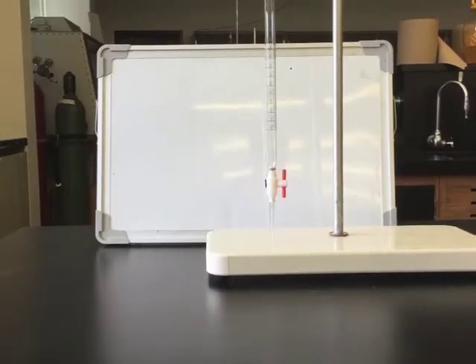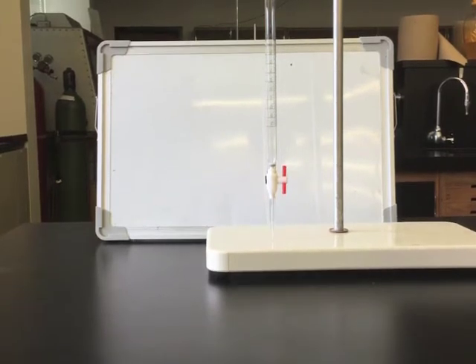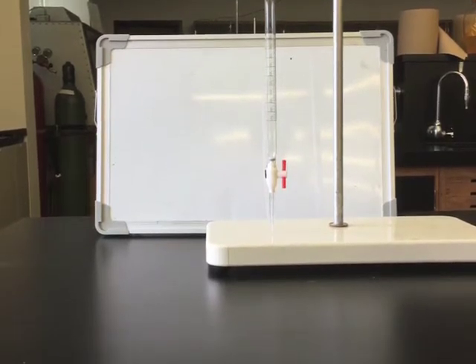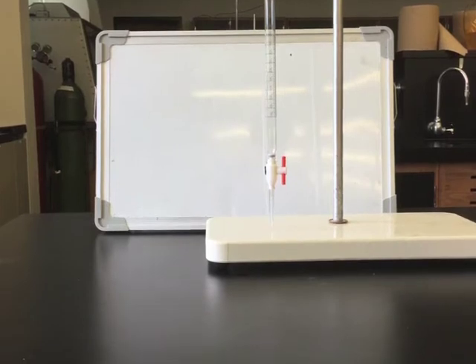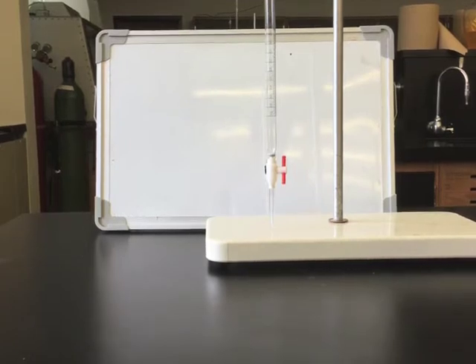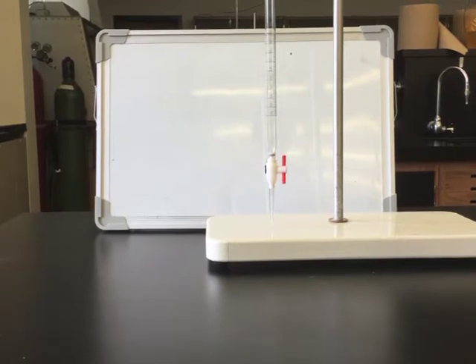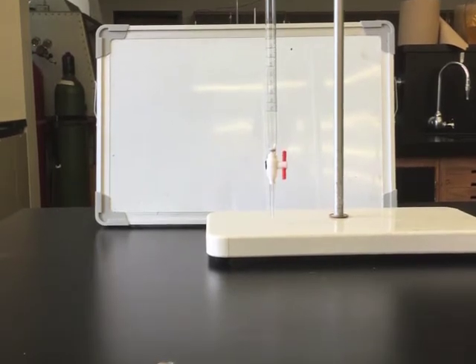For part two, you will be using a burette with deionized water. Check with your instructor about whether you will need to clean the burette before you begin or if you can assume that it is clean. Be sure that you use deionized water and not tap water. Tap water will have a different temperature and may contain minerals that will change its density. To keep our results consistent, we will use deionized water, which should be as close to pure water as we can get for this lab.